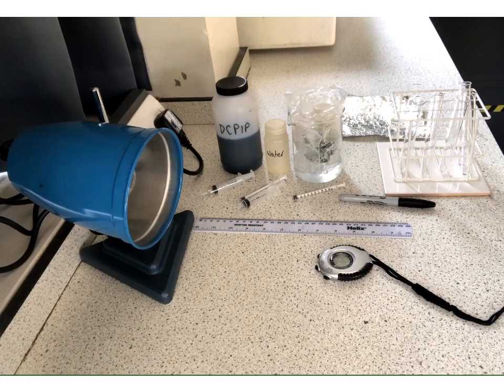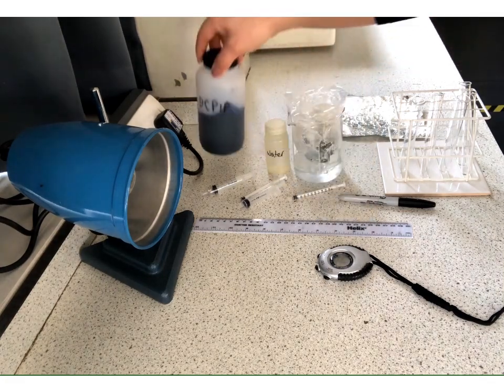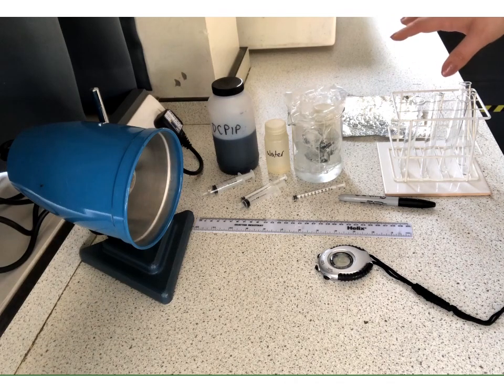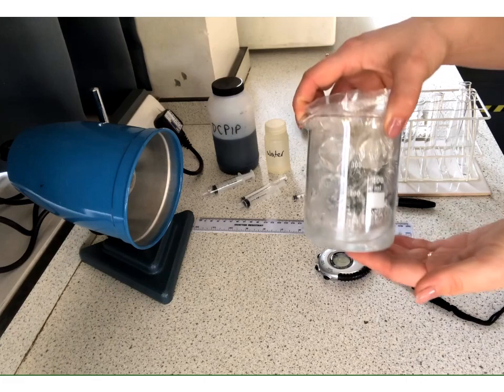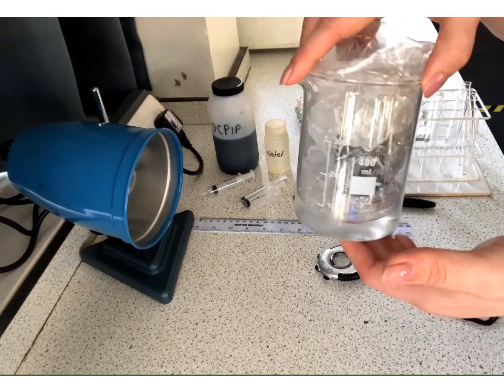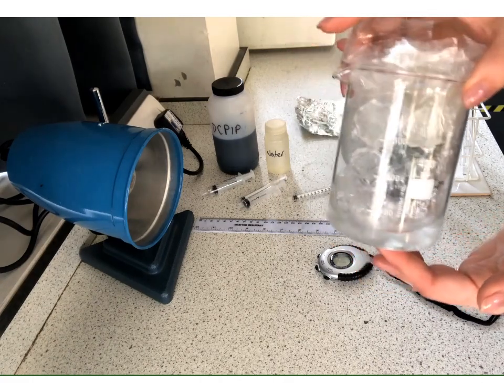In this video, we're going to run through one of the required practicals, which looks into the effect of light intensity and changing it on the time taken for chloroplasts to decolorize a solution called DCPIP. So for this investigation, let's just run through what apparatus we have. So we have got an extract of chloroplasts in here. Now this is being kept on ice, so it's being kept cold. Consider why it would be of benefit to keep these chloroplasts cold.